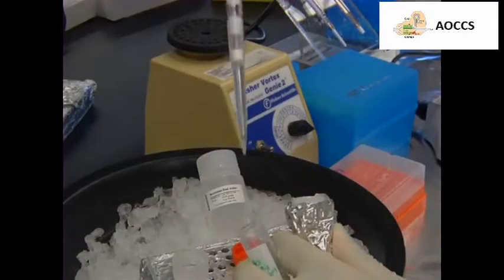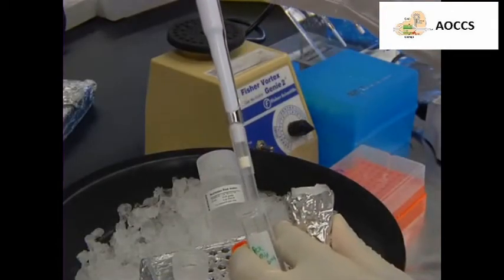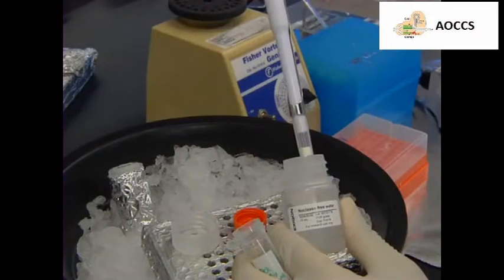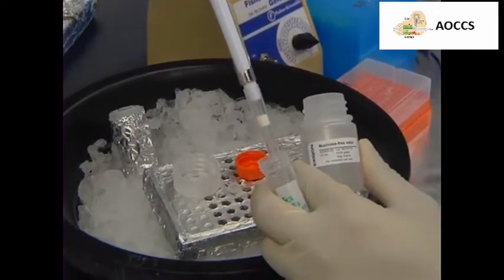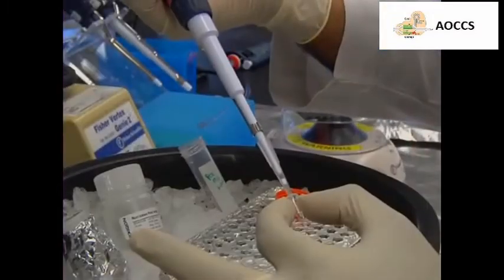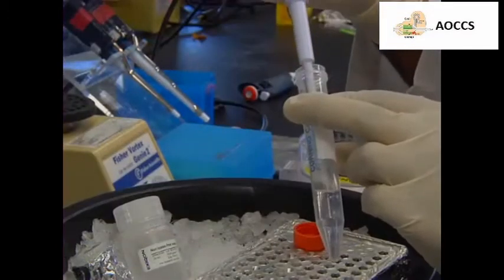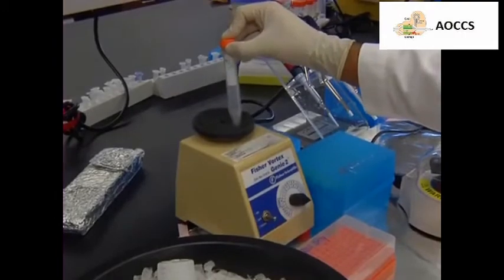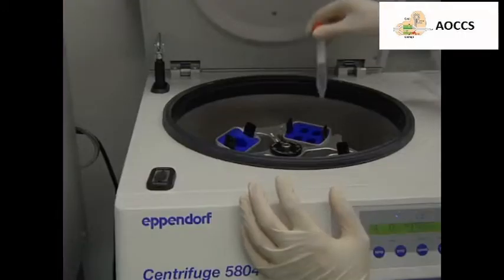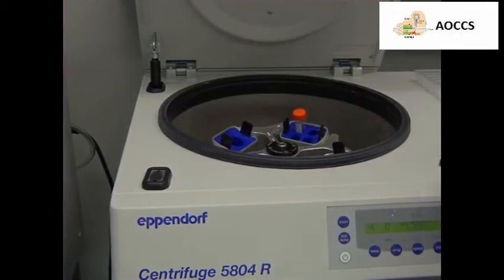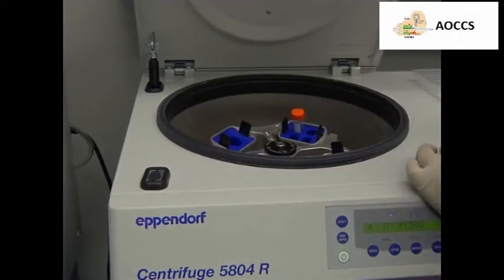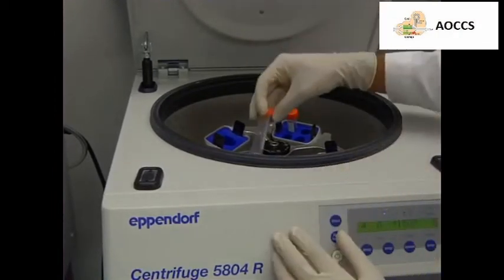Next, combine 2,000 microliters of 2X PCR MasterMix and 1,980 microliters of water in a 15 milliliter conical tube. Add 20 microliters of the cDNA to the mixture and gently vortex the solutions for 1-2 seconds. Then, spin the solutions down in a refrigerated centrifuge at 1,500 times G for 1 minute at 4 degrees Celsius.